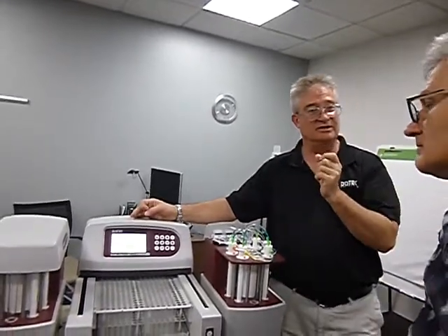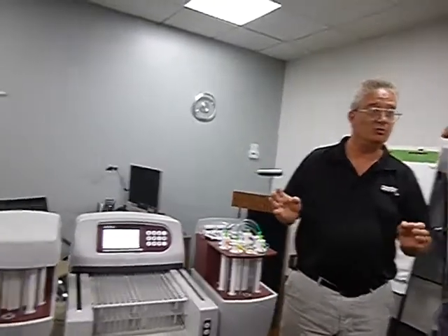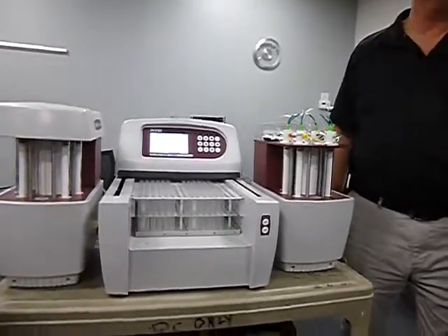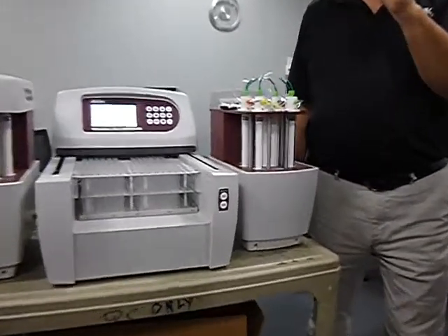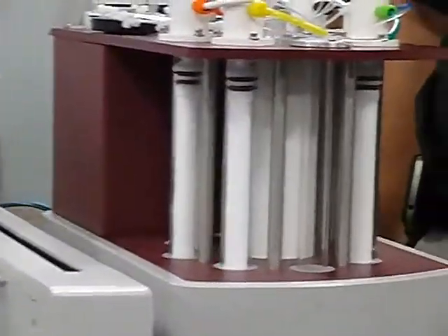And that's telling you, okay, you want to run this thing at every 5 minutes do a pull? Well, then we're going to have to speed this up. And you can watch as you change the speeds in all three, collection, sample, and other, that minimum time get smaller or larger.